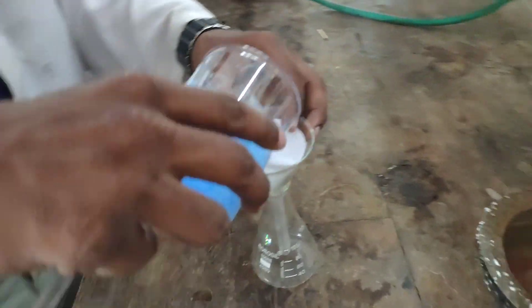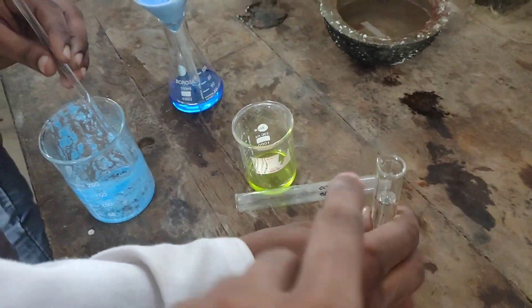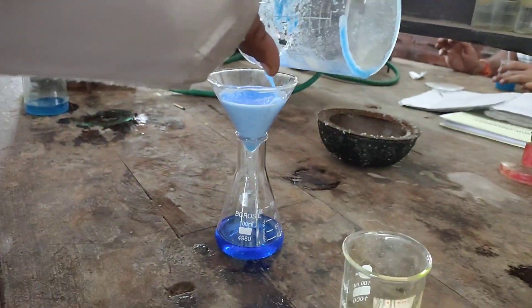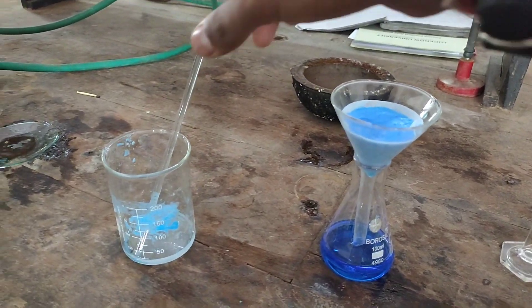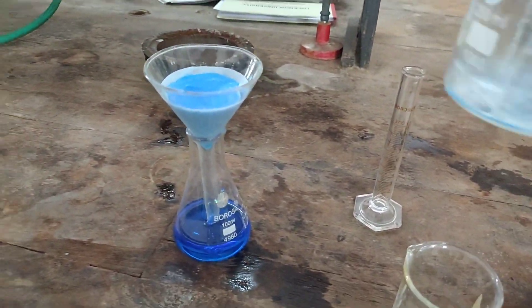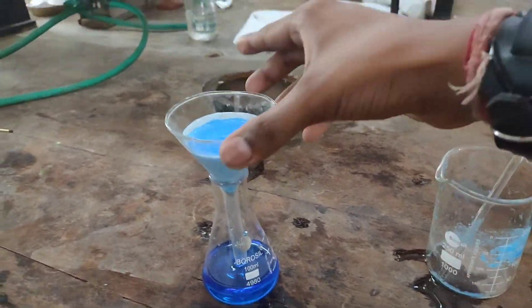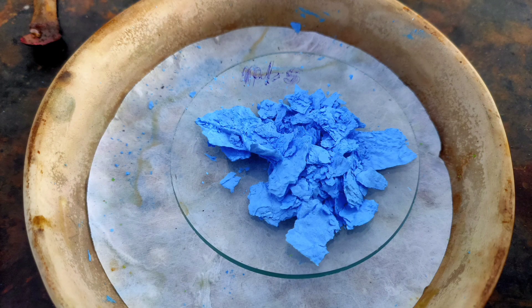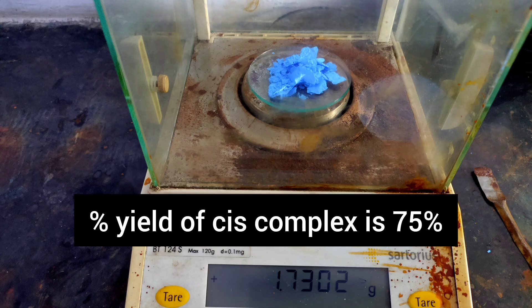The solution was cooled to room temperature and then filtered. The precipitate was once washed with 10 ml of methanol-water mixture, and then washed with 10 ml of methanol. After washing with methanol, it was air dried. It has to be preserved for the transformation of cis to trans complex. The yield of the cis complex was 1.73 grams, corresponding to a percentage yield of 75%.